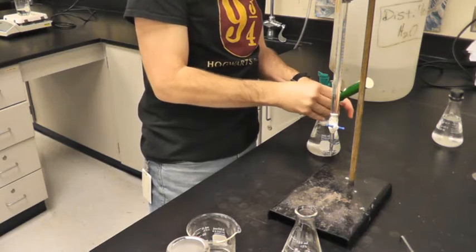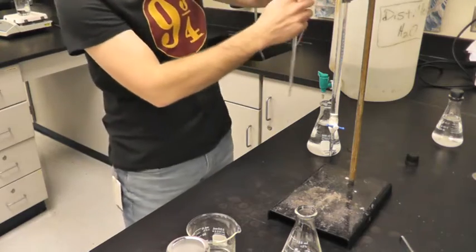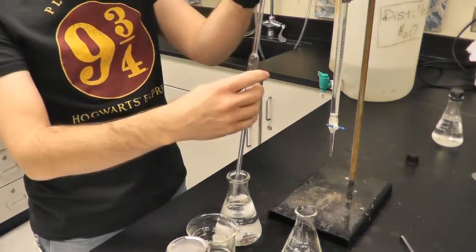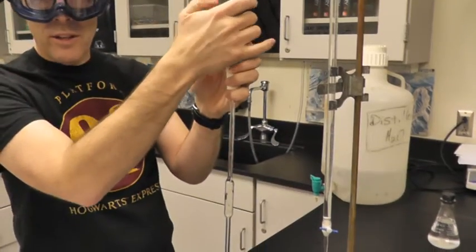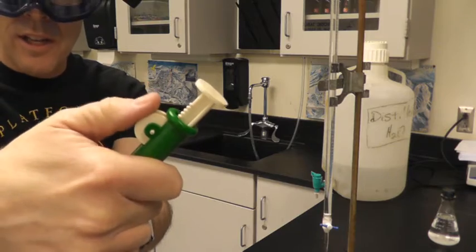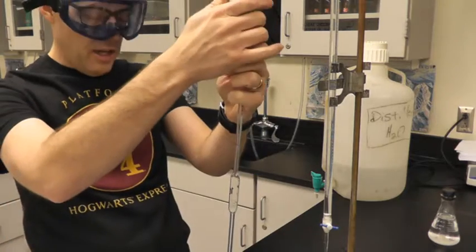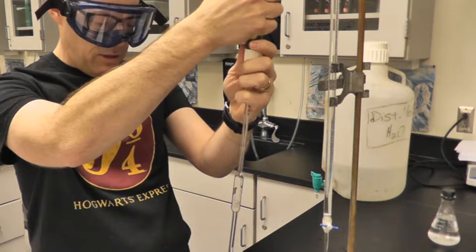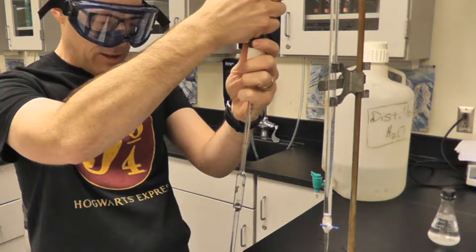And what I'm going to do is I'm just going to suck off, or draw off would be a better way to say it, exactly 10 milliliters. So the way this works is, you can't really see everything in the video. Up here, there's this little round thing. As I spin it, it's going to create a suction, and it's going to raise liquid into my volumetric pipette. And I just want to get it from the top of my solution, because I don't want to get any solid in my solution. So I'm being careful to only get it from the top, where hopefully my calcium and iodate ions are floating around.